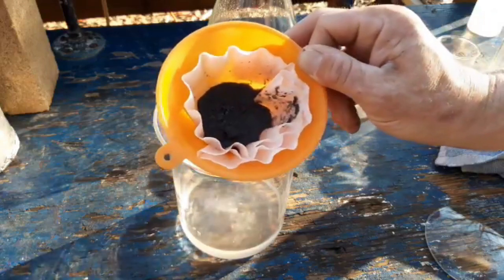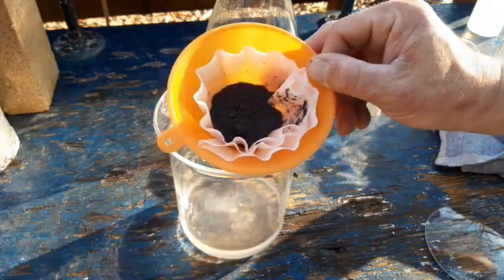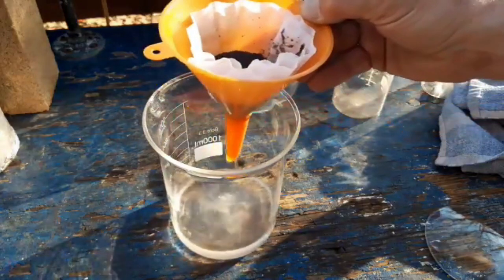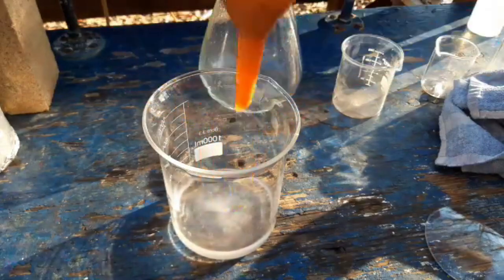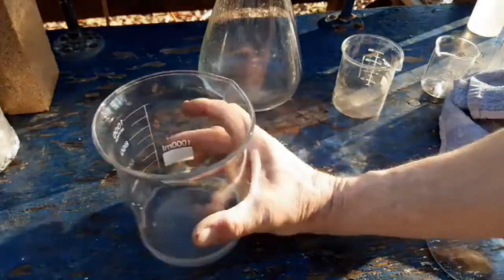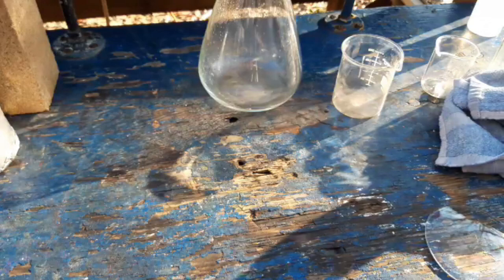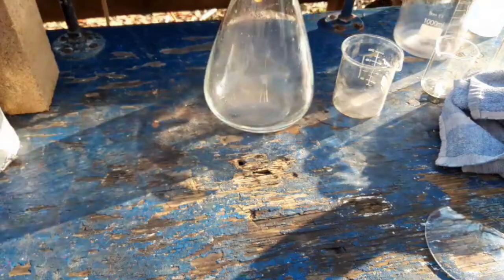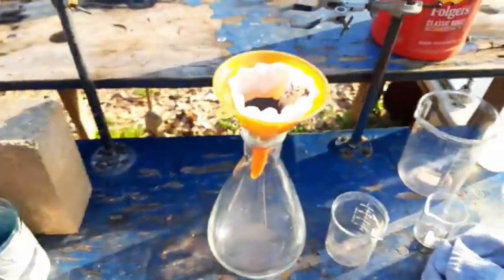This kind of looks just like metal powder, but let's pour it out and see. First, let me get rid of all of this highly volatile, flammable stuff because I don't feel like dealing with a fire. Don't get your panties in a twist — it's just acetic acid, ether, or heptane. It'll either evaporate, or it's acetic acid, which isn't toxic.